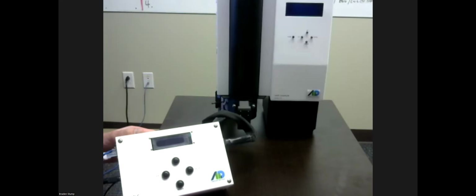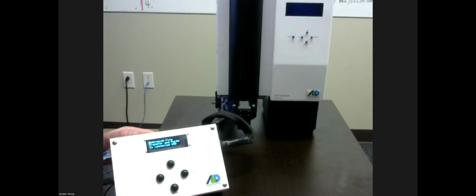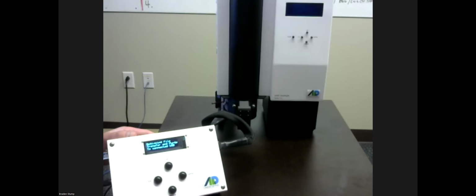and as an aside, while we're waiting for this to load, all of this is assuming that your spot sampler is already set up exactly the way you want it. You can use liquids other than water in the liquid vial. We have seen different reflectivity, and you're seeing beginning file transfer to the USB here. We've seen different reflectivity of different sample types be fine. As this is beginning the file transfer, transfer complete, files moved 574, reconnect sampler, then reboot.